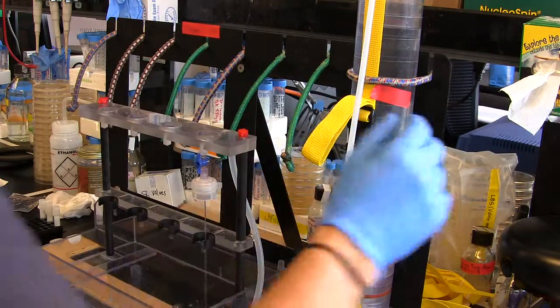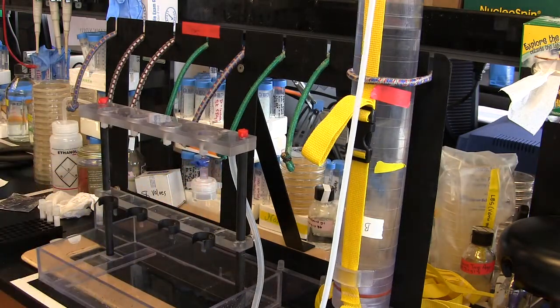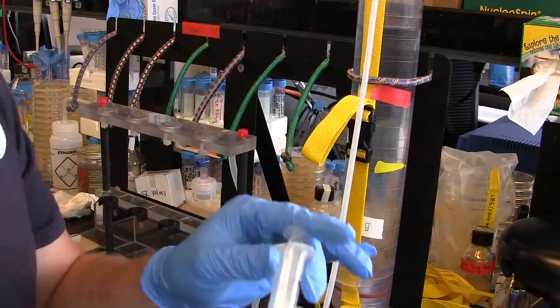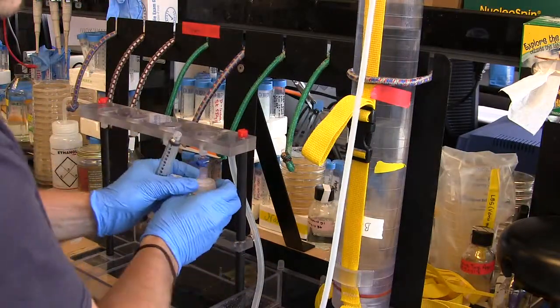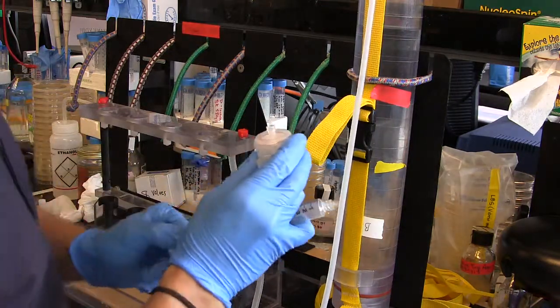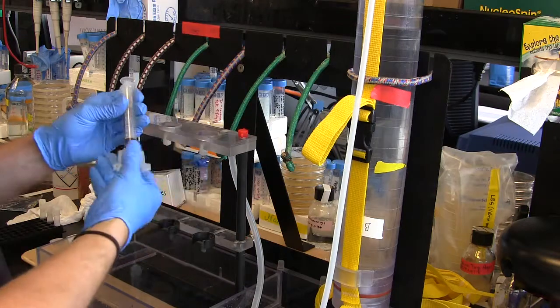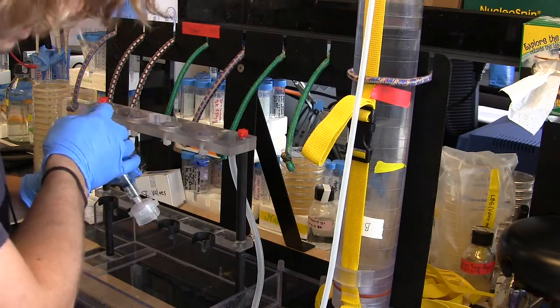The 500 mils has been flowing. I keep a 10 ml syringe open from the start of the cruise — that's my air syringe. Take the filter off, make sure it's dry on top, fill the syringe with air, screw it on, and flush all the excess liquid through to get that filter nice and dry. I usually do that twice because a dry glass fiber filter is much easier to handle than a wet one.